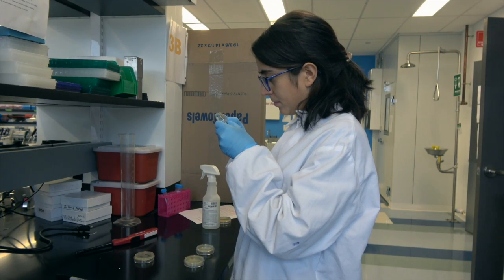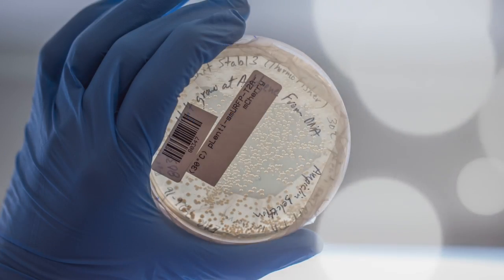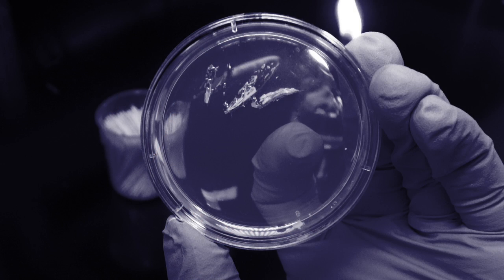Though simple in concept, the procedure that you follow can make this process go very right or very wrong.